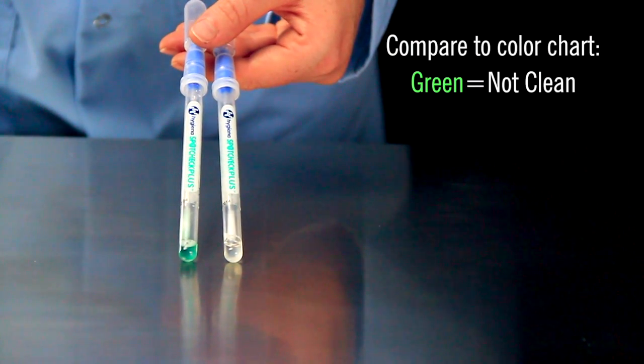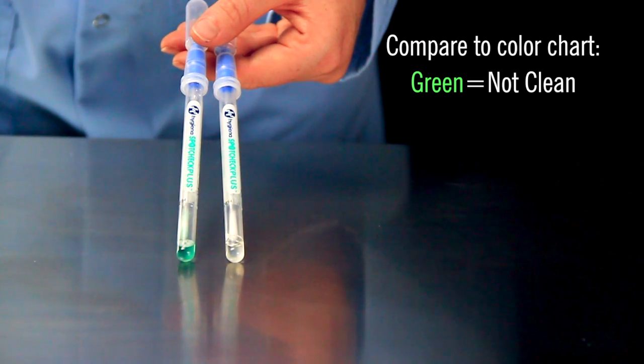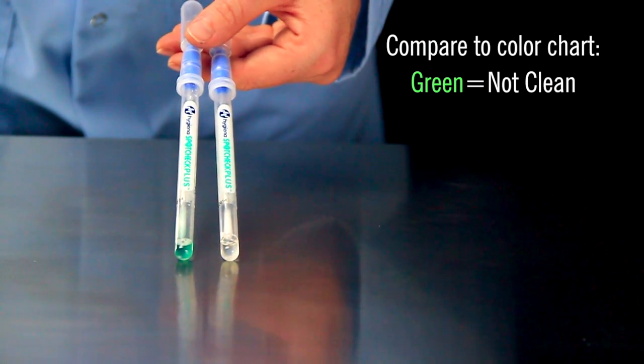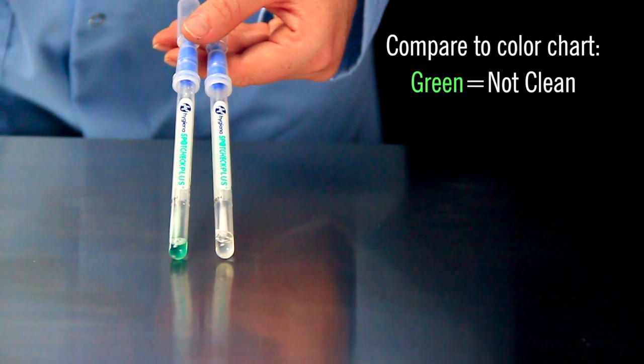After 60 seconds, if it turns green, it isn't clean. If no color change occurs after 2 minutes, the test is negative and the surface is clean.